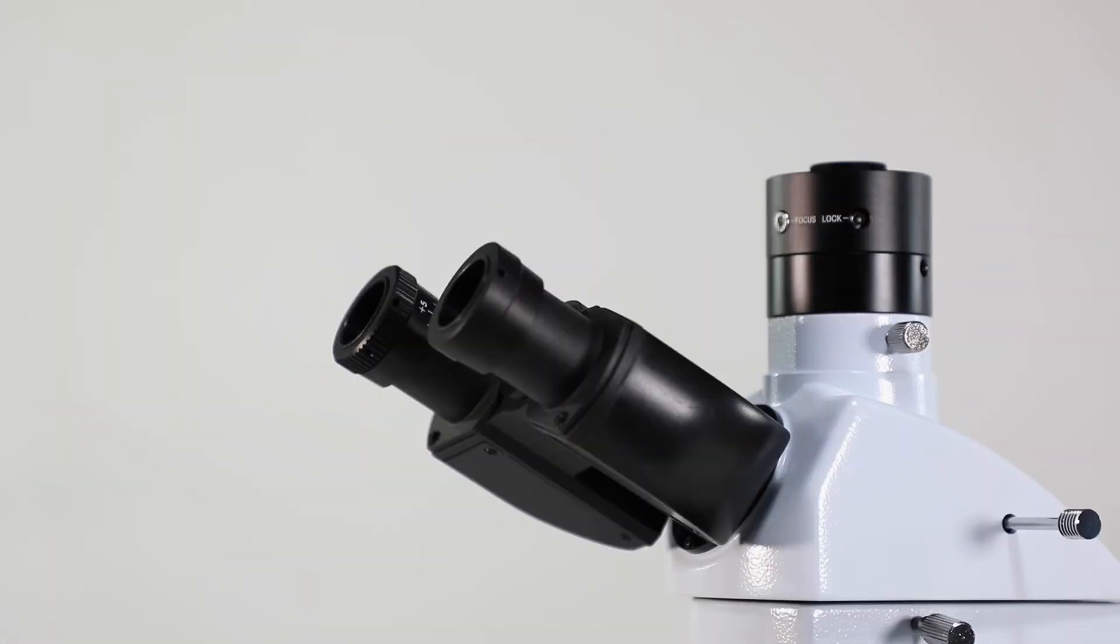The diopter is an individual eyepiece focus for those who may wear glasses or contacts or have different vision in each eye.